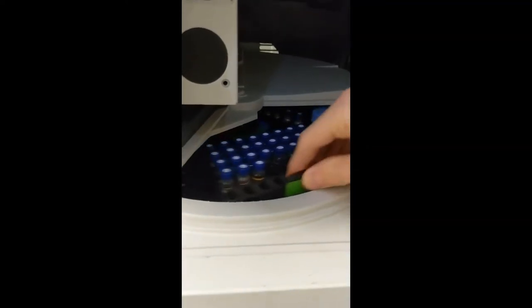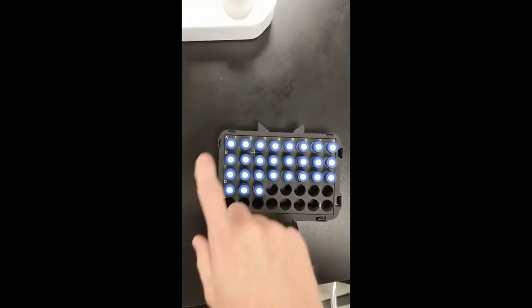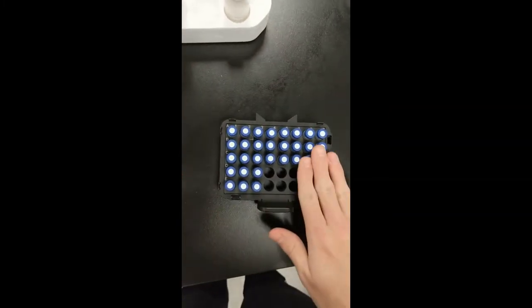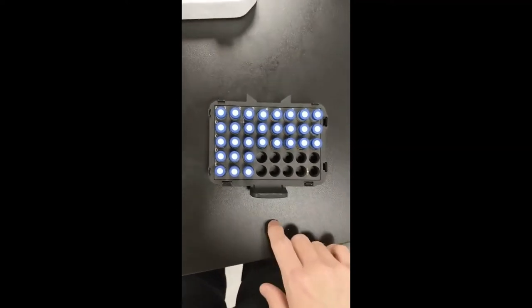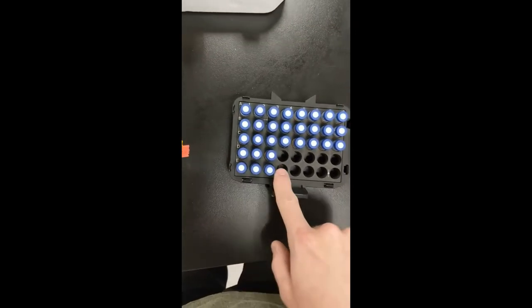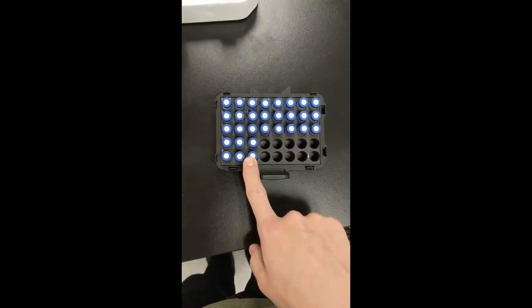As an example, let's fill the green tray right now. I've got my tray out and my three samples that I want to run. You can see that there are letters A through E and numbers 1 through 8. I'm going to put my samples in the bottom three spots. These are someone else's samples — you don't usually want to touch other people's samples unless they're done running. When I input these locations in the instrument, I'll have to specify it's the green tray, row E, and spots 1, 2, and 3 — so GE1, GE2, and GE3. We'll need to remember those numbers later for when we make our run sequence.